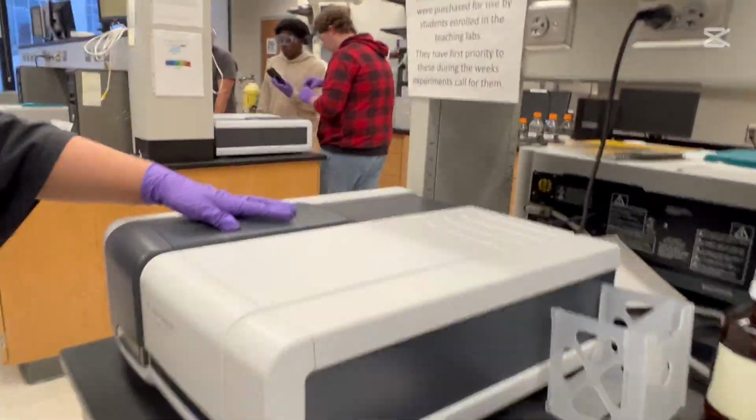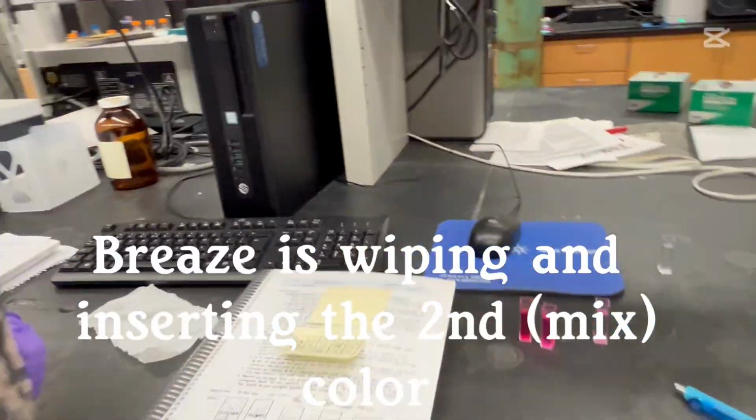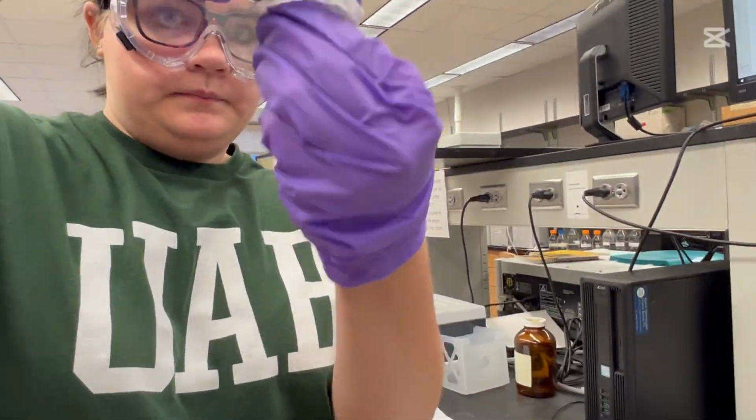Close that back up. Okay. Now I am taking our next color, just between the two colors. I am wiping it down.